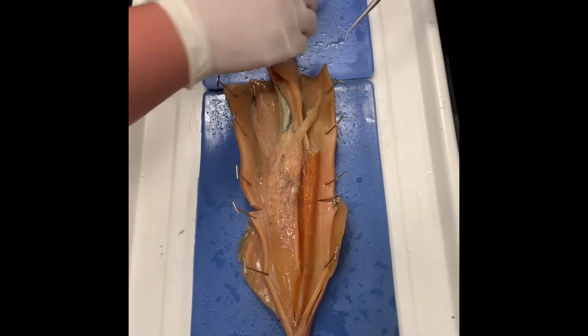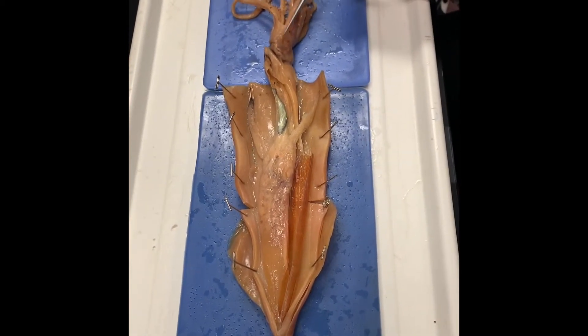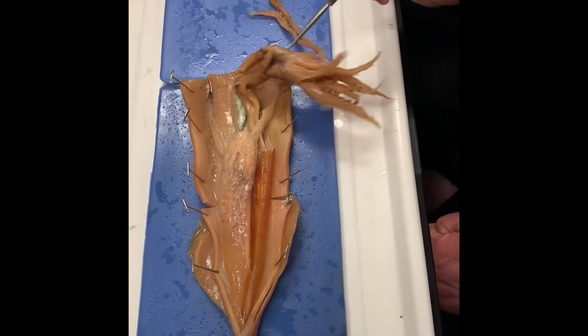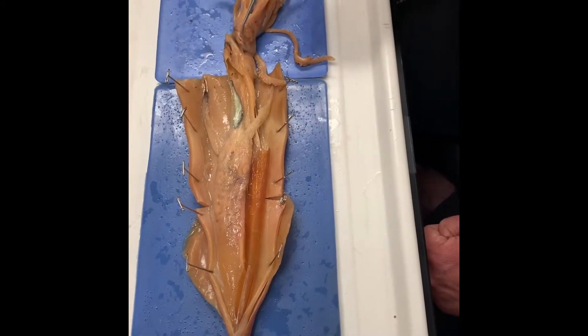The eye — they also mentioned here. So this is the eye. Notice it's kind of covered by tissue, but there's a nice large eye. And then there's another one over here on the other side as well. That's its eyes.